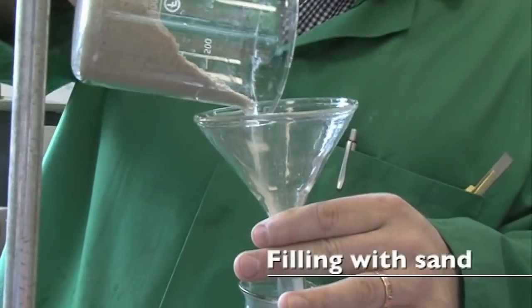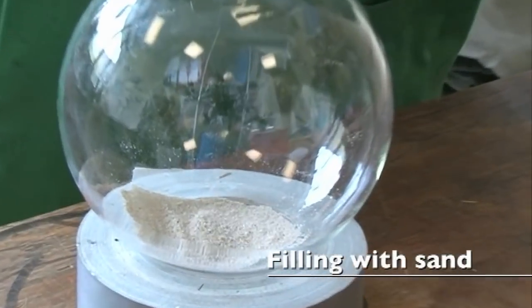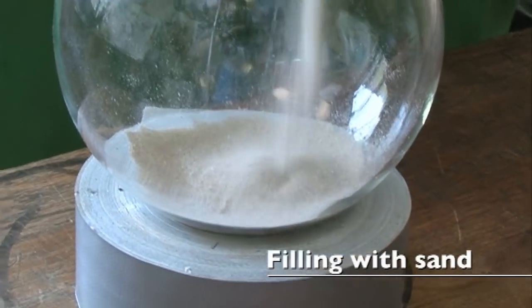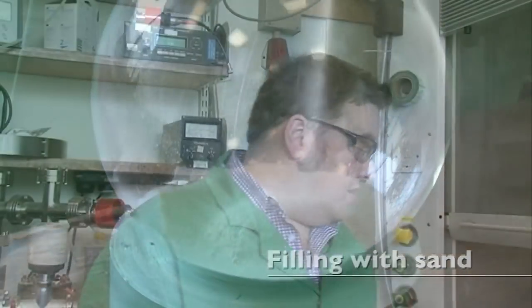Now all of these bonds inside this structure are very, very strained. They want to release energy really quickly, so they want to react with reactive things. We're going to react it with oxygen to form the oxide P2O5. And we're going to do that today in this flask.